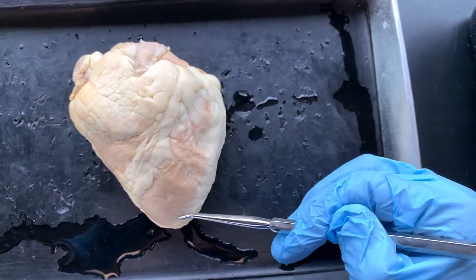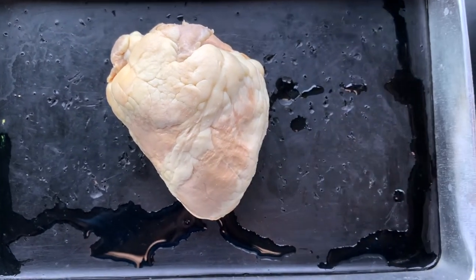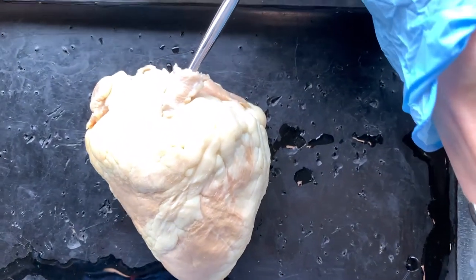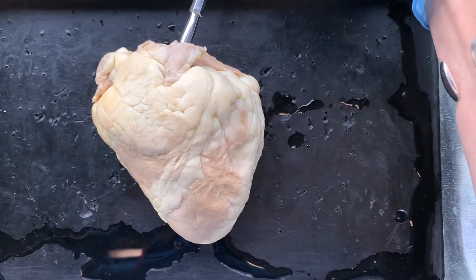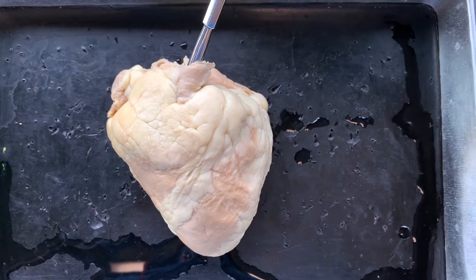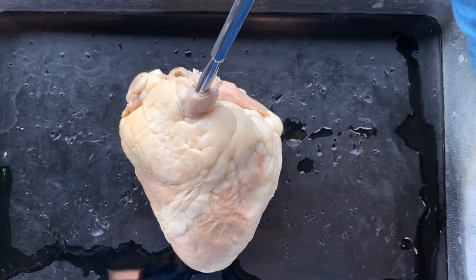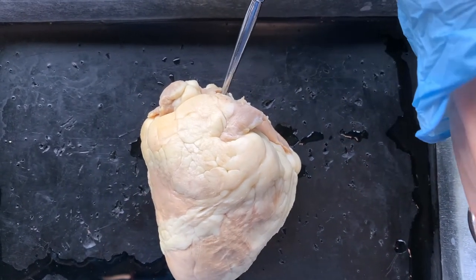Notice that it's very large. If we're thinking about the pulmonary trunk — which I said was kind of like the nose on your face, the thing that you want to always find first on the heart — well, here it is on this sheep heart. The pulmonary trunk is right here; I've put the probe in it. Normally it would split into the right and left pulmonary arteries. And we note that the aorta would be right behind it — and there is the aorta right behind it.